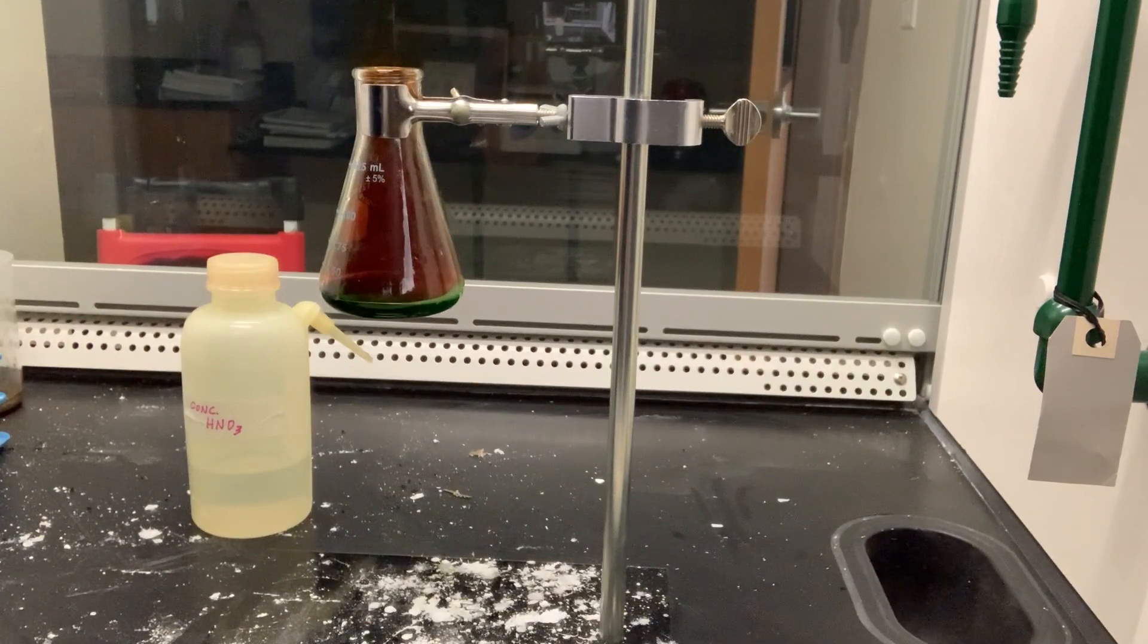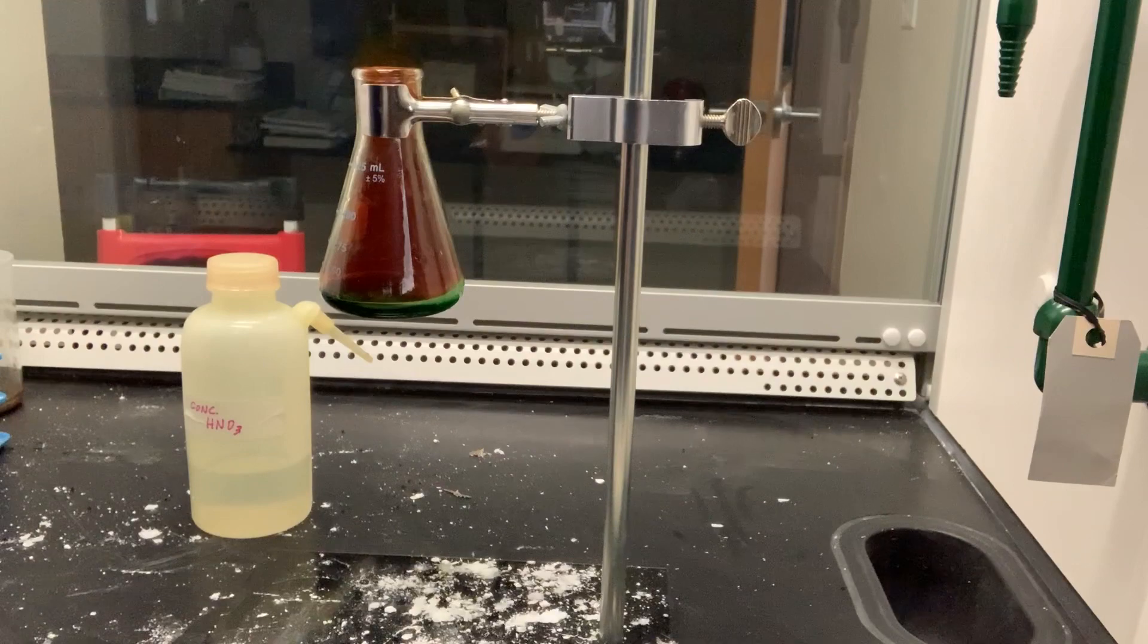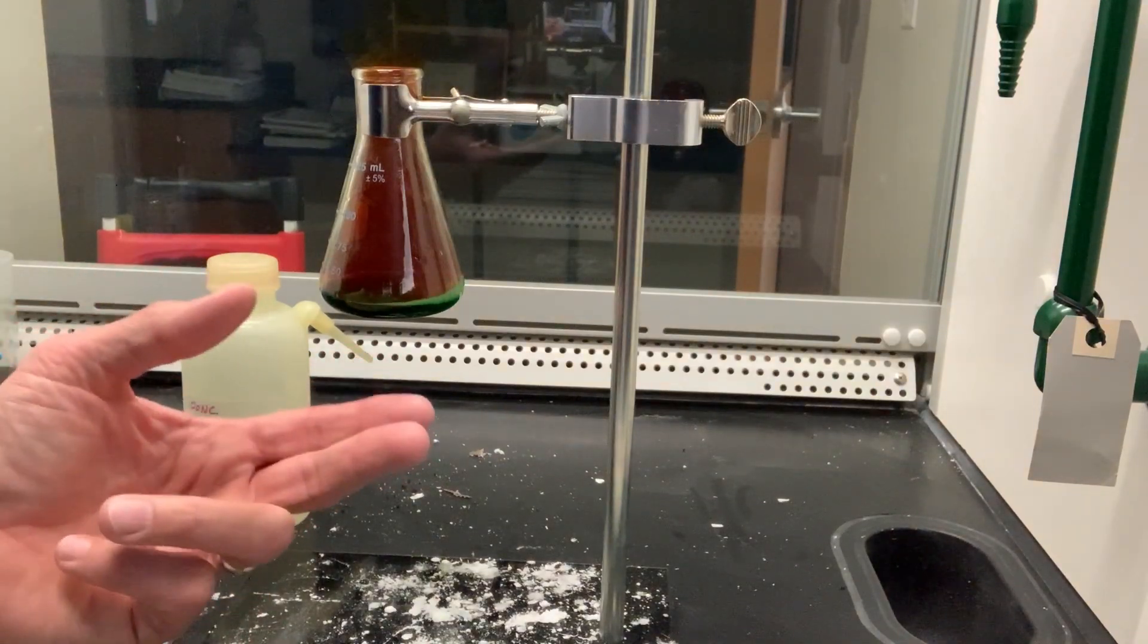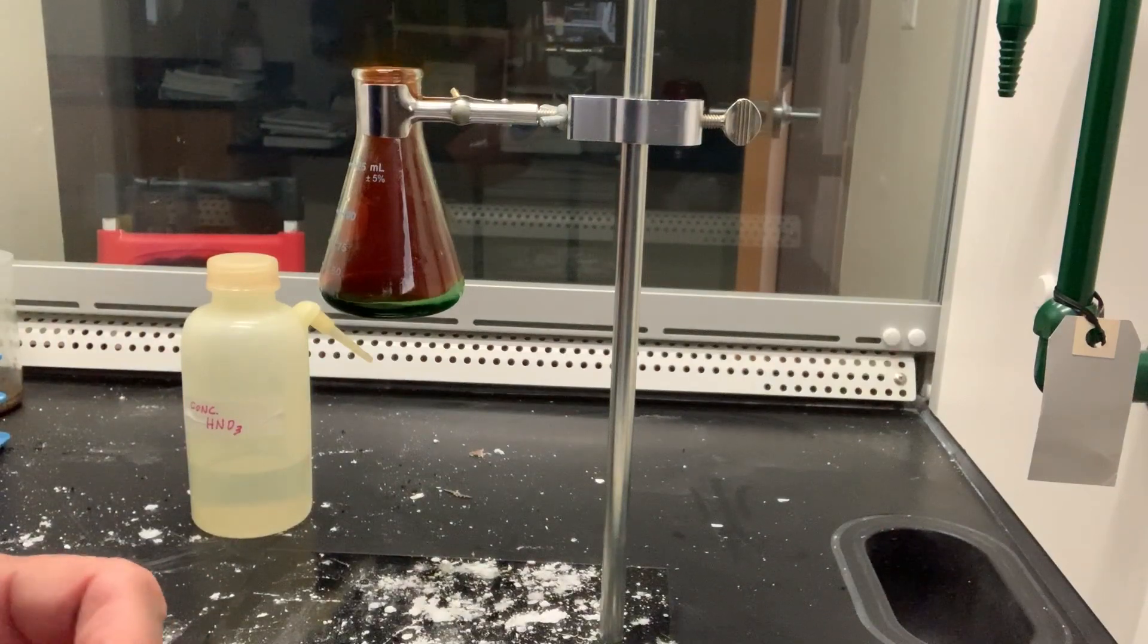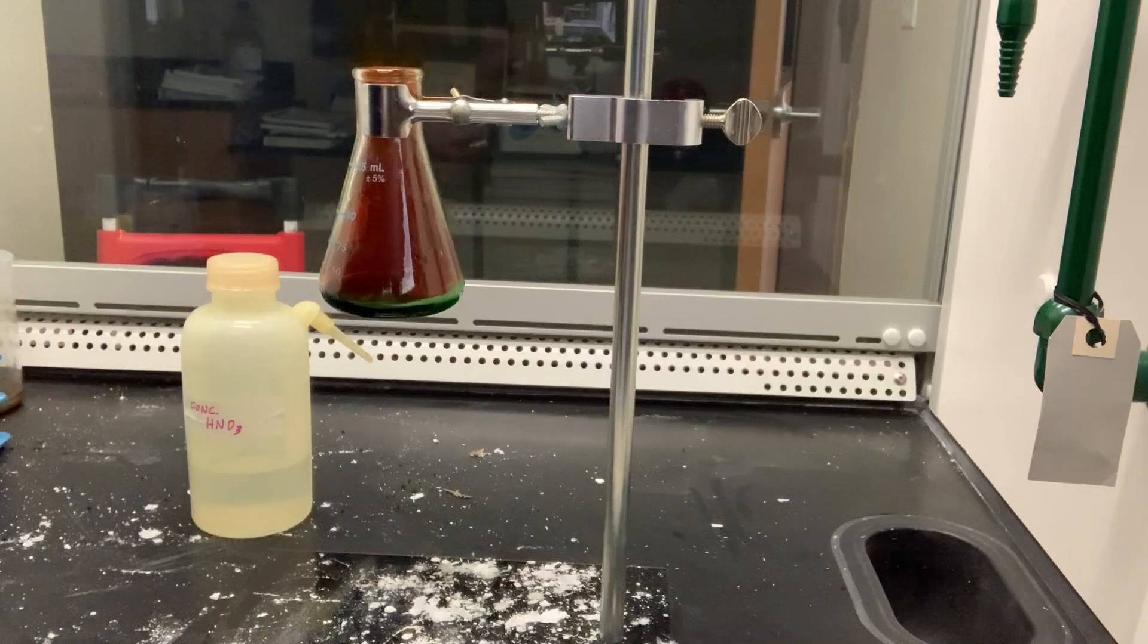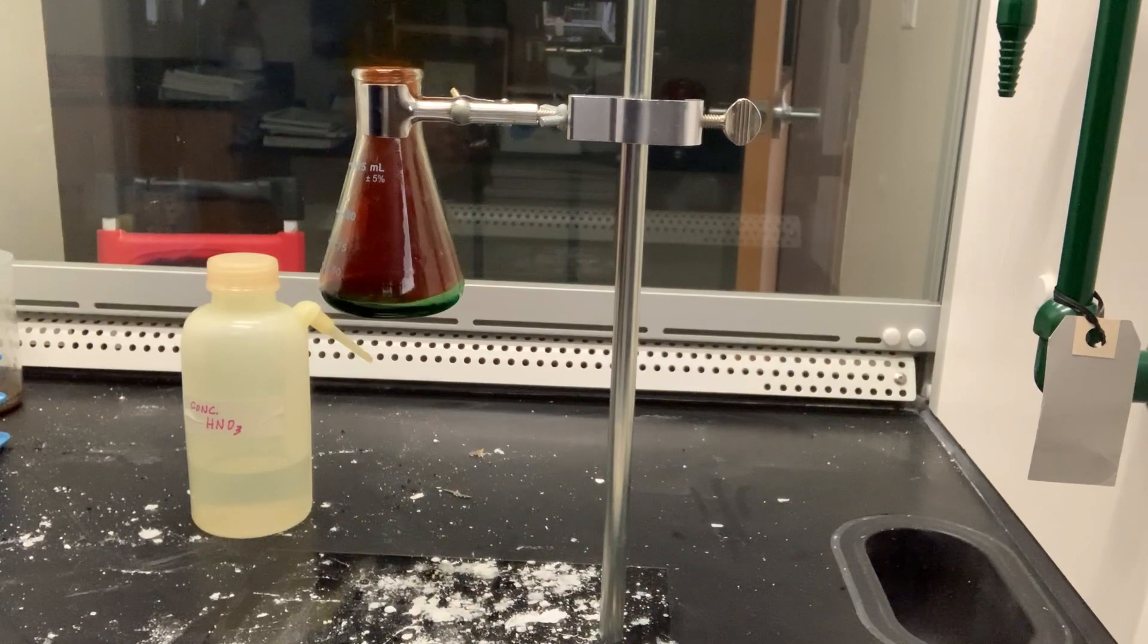I tried to get rid of the objectionable mess by picking it up and throwing it out the window, which I had meanwhile opened. I learned another fact: nitric acid not only acts upon copper, but it also acts upon fingers. The pain led to another unpremeditated experiment. I quickly drew my fingers across my trousers, and another fact was discovered: nitric acid also acts upon trousers.